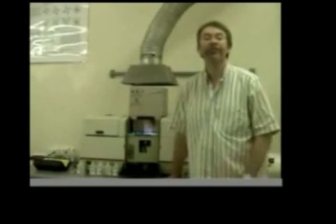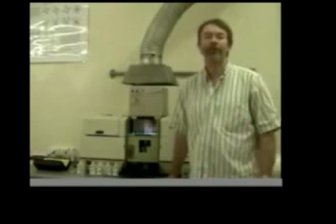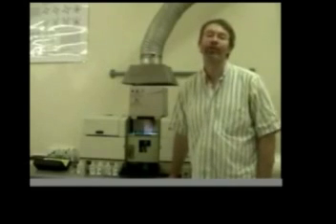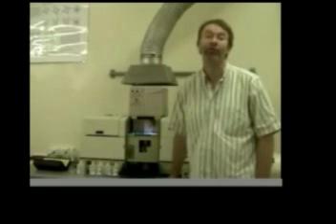This is an atomic absorption spectrometer. It can be used to both quantitatively and qualitatively determine the amount of copper in an ore sample.